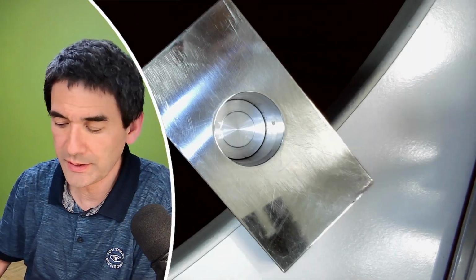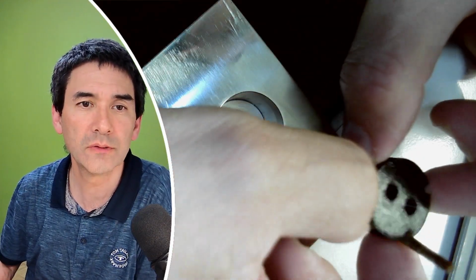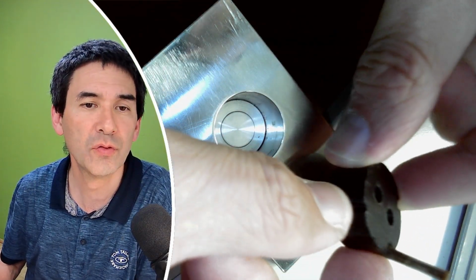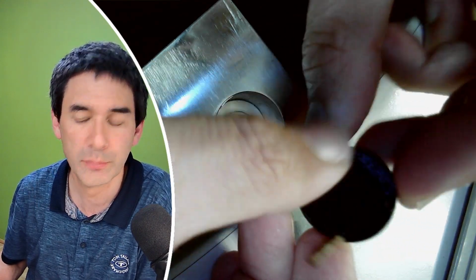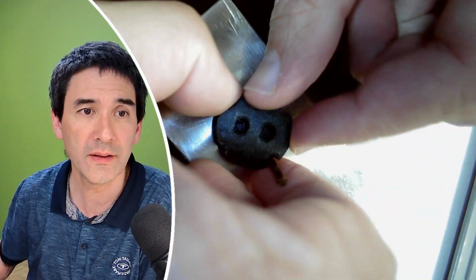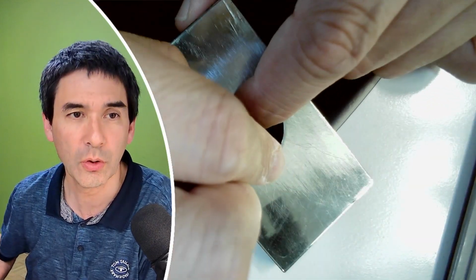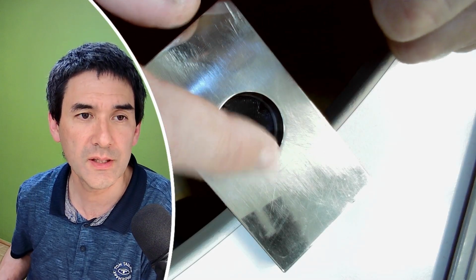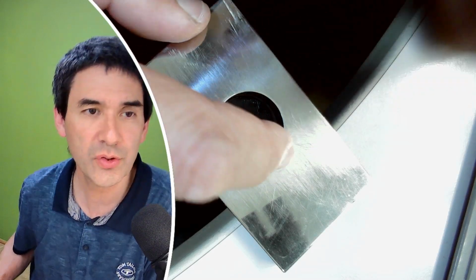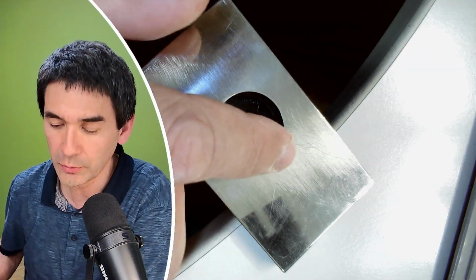Yeah, so here it is. Over here, this is the specimen holder, right, with the piece of wood inserted here. Okay. And I'm now going to put it into the Microtome like this, and you push it all the way down. Okay, yeah, so here it is. And I'm now going to start, let's move the microphone over here as well. I'm going to start cutting it.